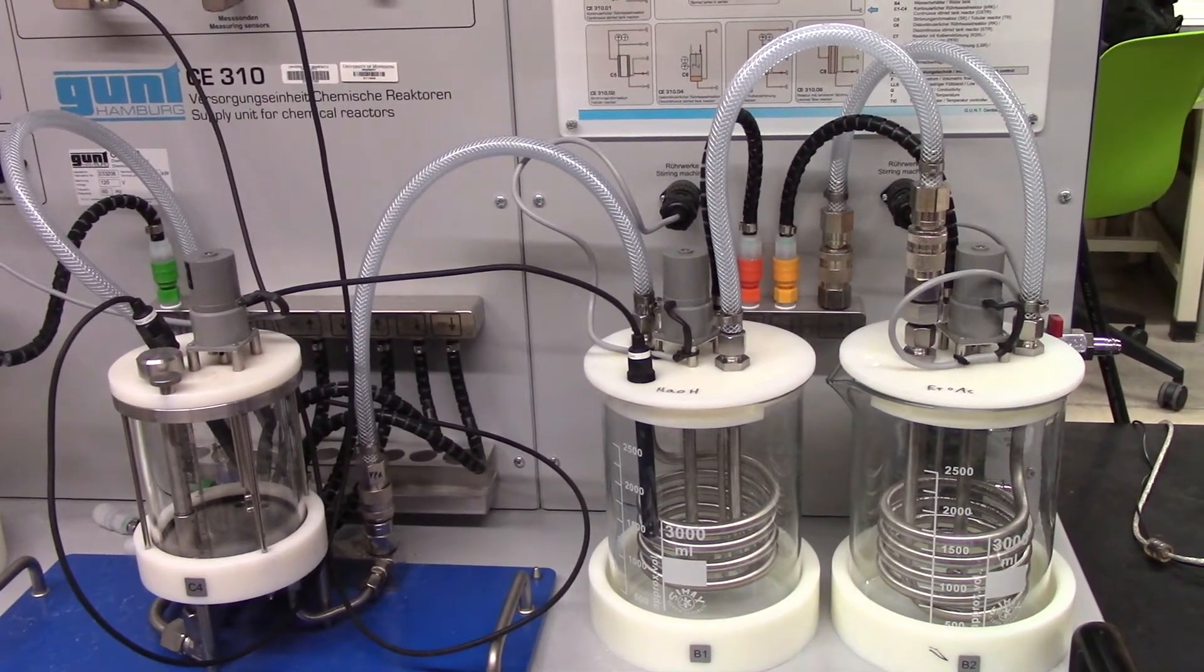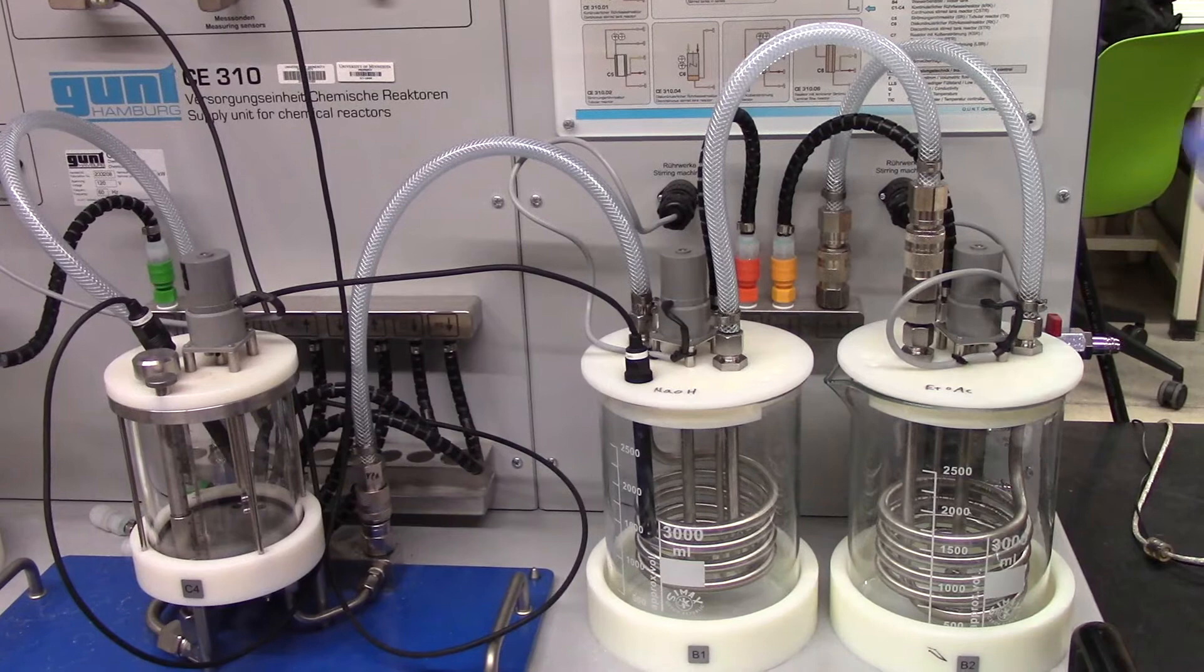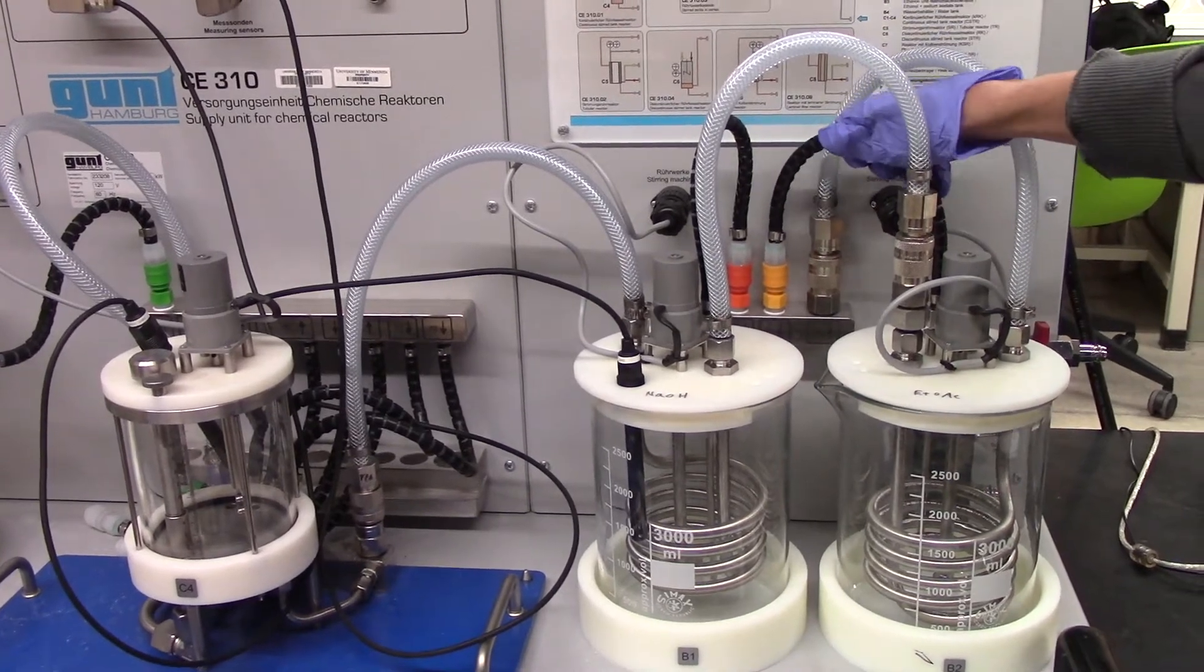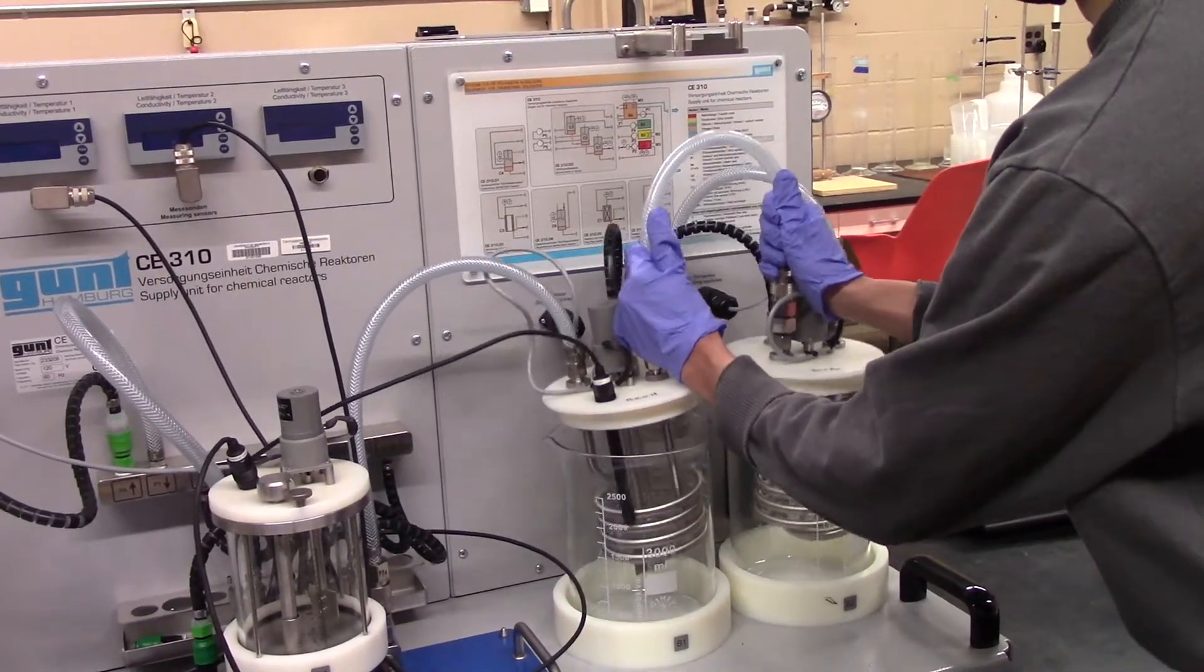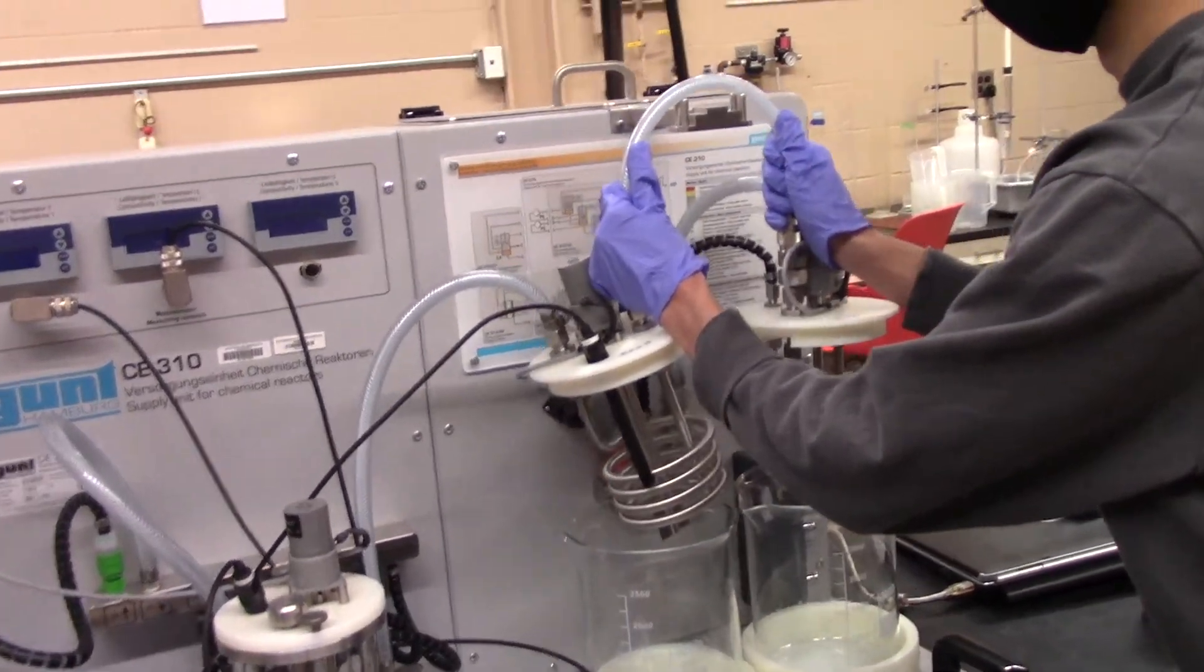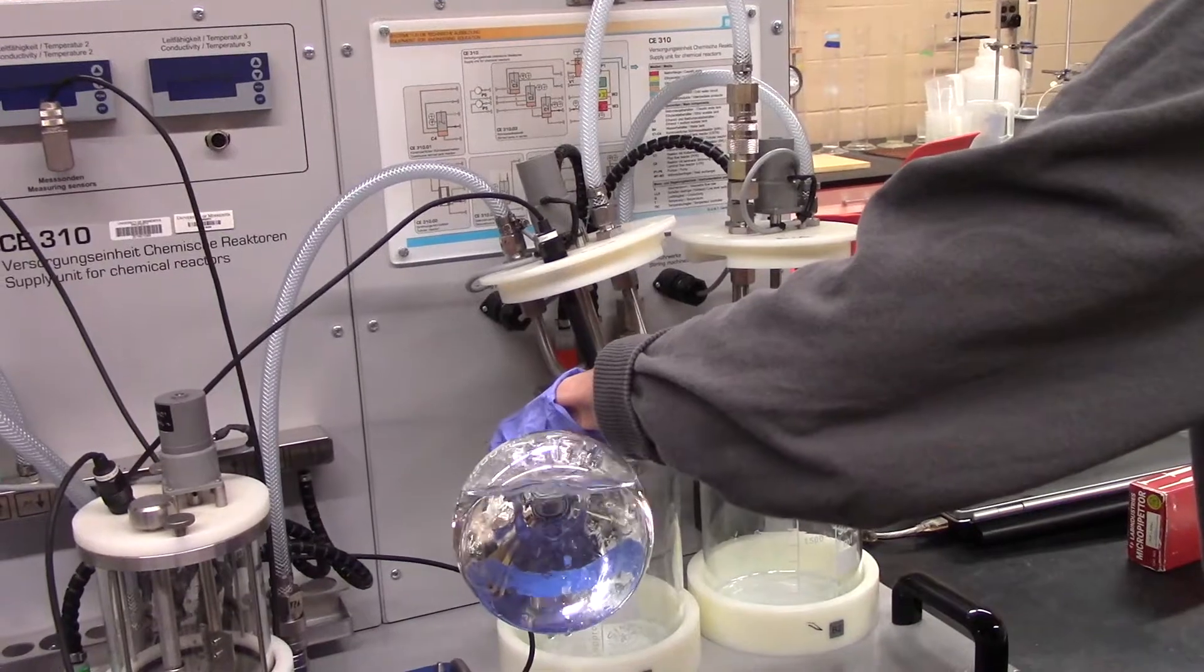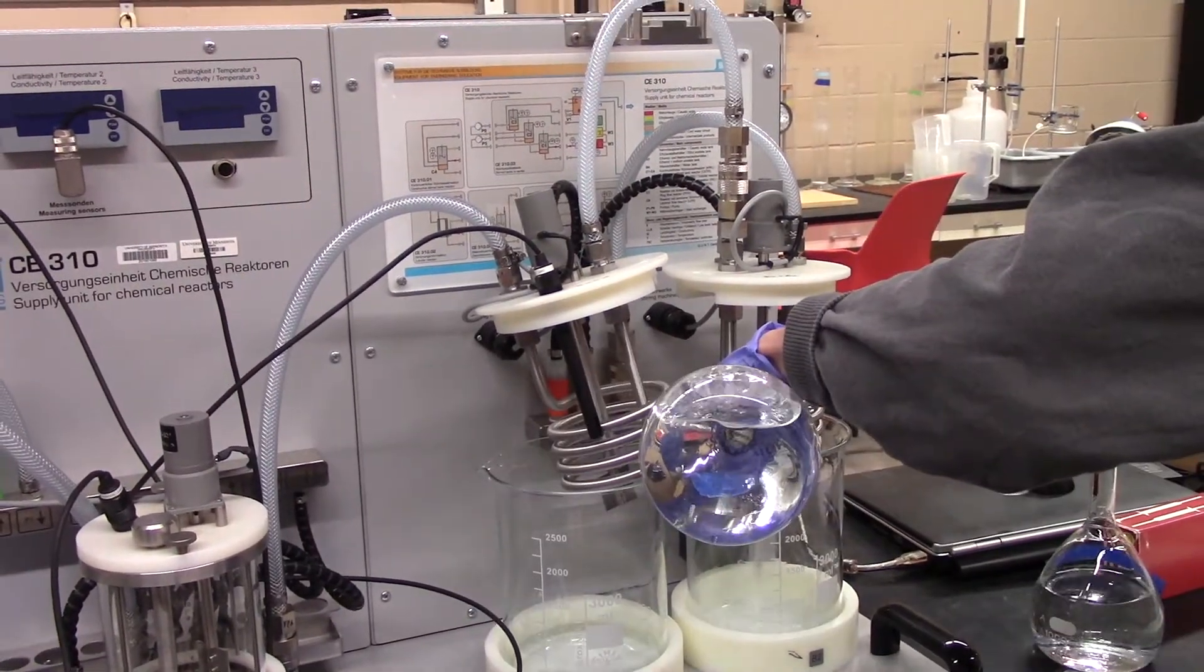Now, before beginning the actual experimental procedure, it is essential to make sure that all your connections are both secure as well as to each correct unit. Once you've assured that your pump lines are secure, you may suspend the beaker covers, as shown, to fill the beakers with their corresponding solutions easier.